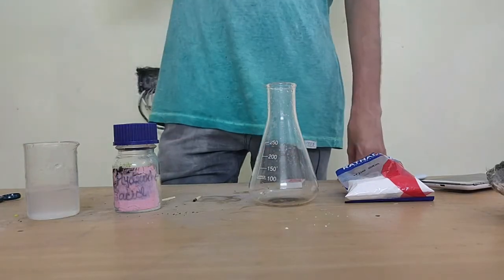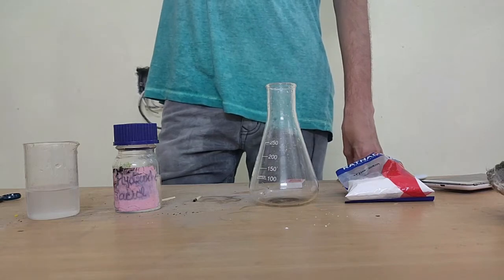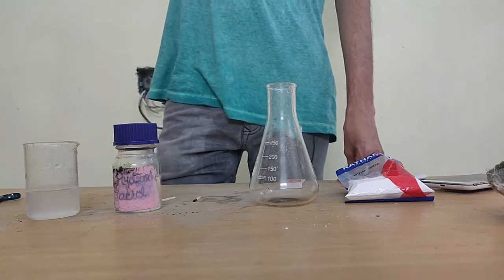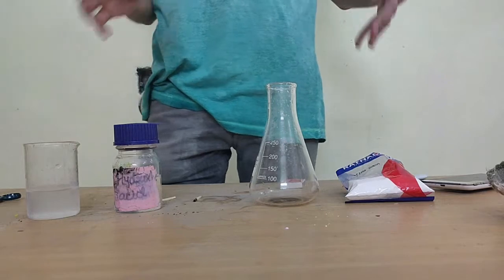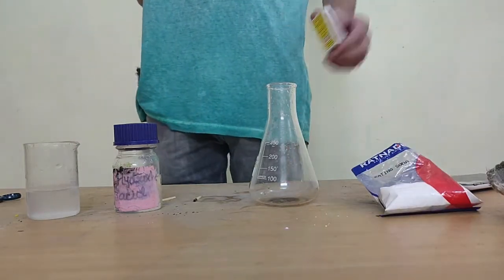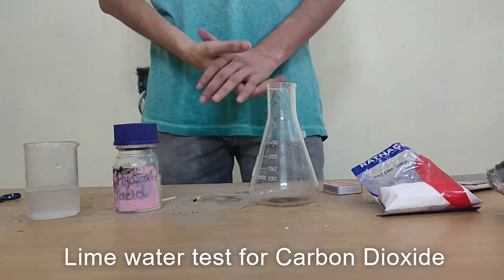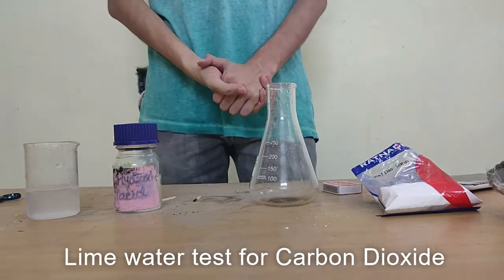Now I think when I say lime water, you should figure out that we'll be testing for which gas, and that is carbon dioxide gas. We'll see if we are able to do the milky test properly today. We'll also do the test with the matchbox where the match gets put off. If that happens, then we'll know that it is definitely carbon dioxide gas.